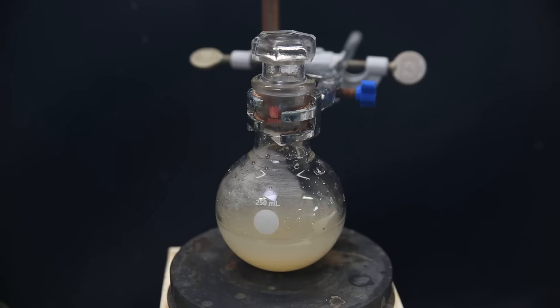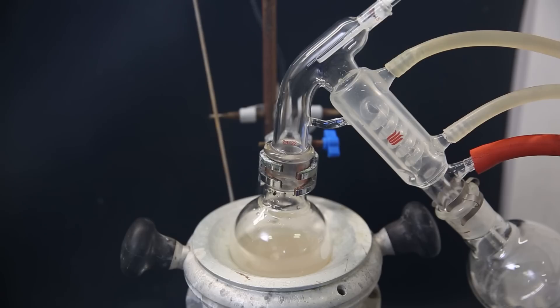When I come back, it looks the same, and I can continue with isolating it. I then wanted to distill off all of the water, but the discolored crap made me change my mind.